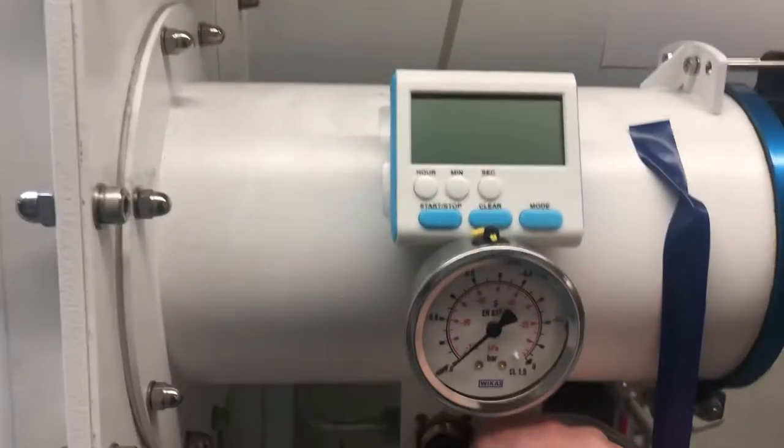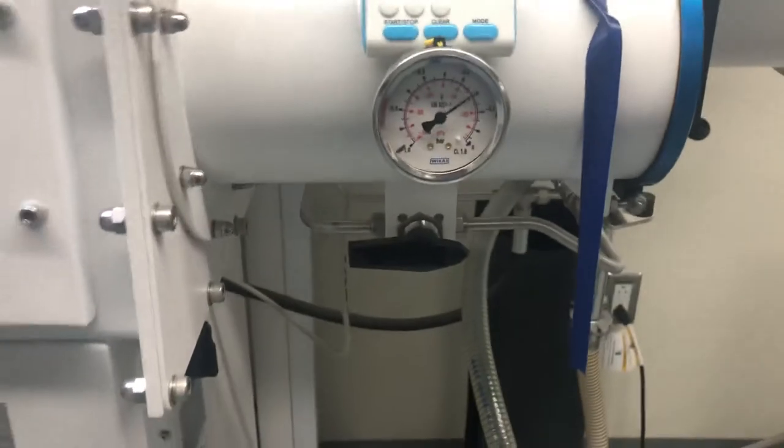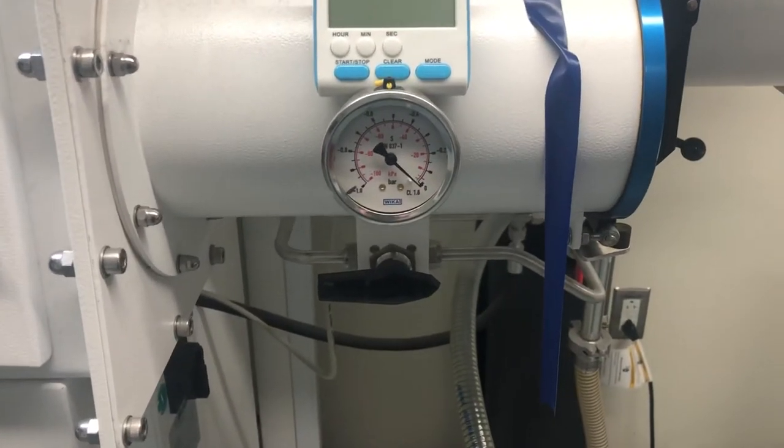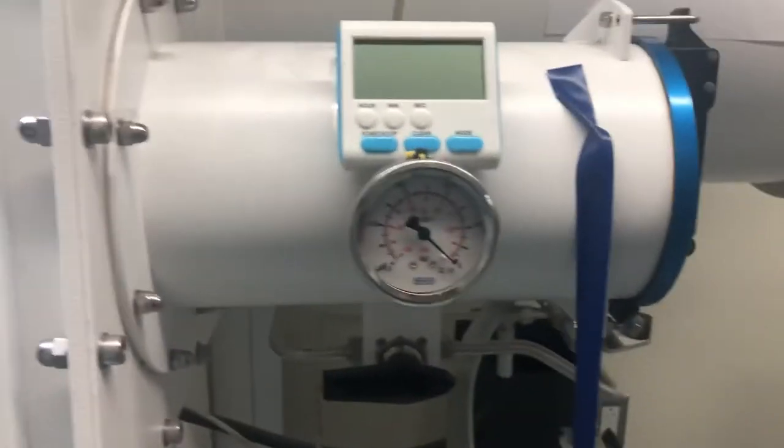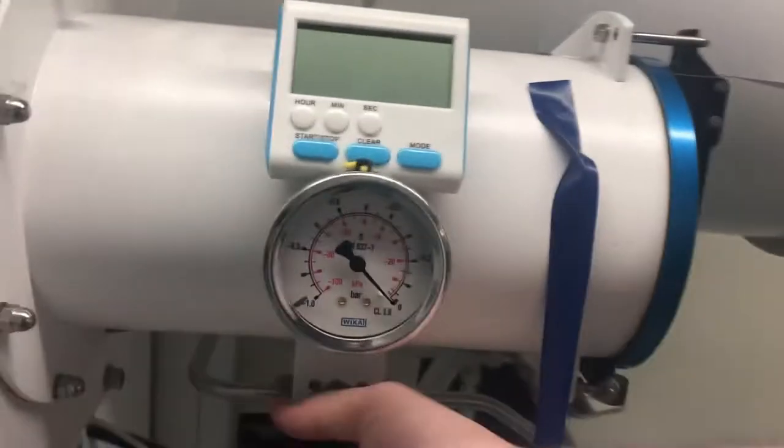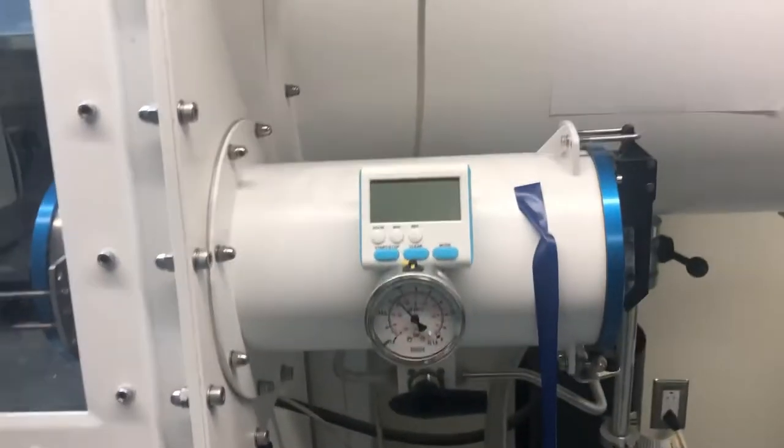Let's say 20 minutes have passed. We're then going to pull this, twist this over to argon. And when we twist this to argon, we're going to let it go back up. And we're not going to let this sit for any amount of time. We're just going to pull it back to vacuum again. Now we're going to go 20 more minutes.